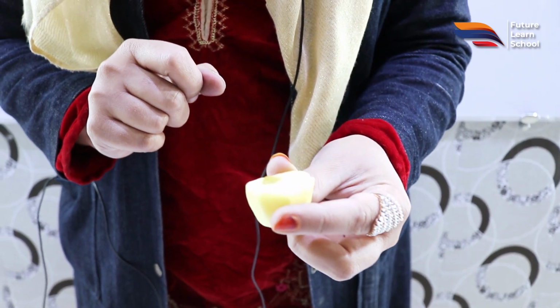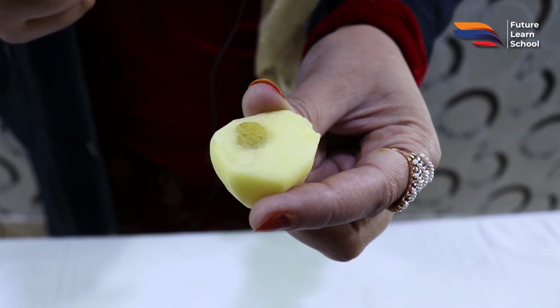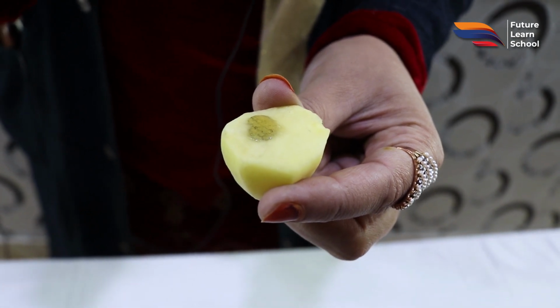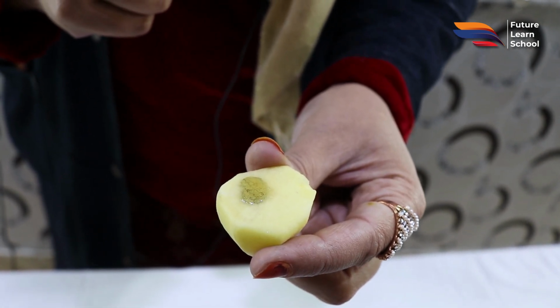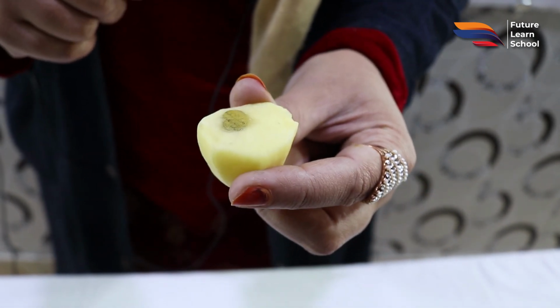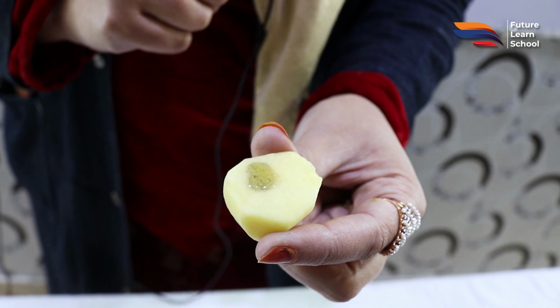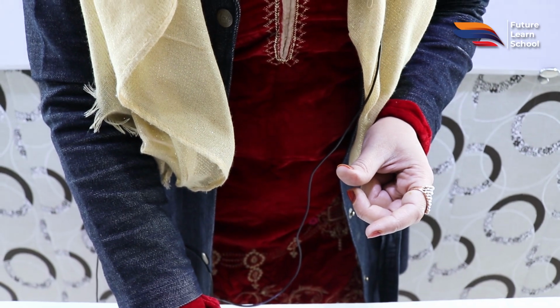And you can see slowly the coloration is getting changed. As the reaction proceeds, a polyiodide complex forms, and the color of the potato at the place where we have added the iodine will turn to black coloration. You can see there is a change in coloration of this potato, and the potato is getting black over the area where we have added this iodine. So it shows that the potato also contains starch, as it is giving a positive test with iodine. The color of iodine was brown, and now this has turned to blackish coloration, you can see. So this was another confirmatory test for the presence of starch.